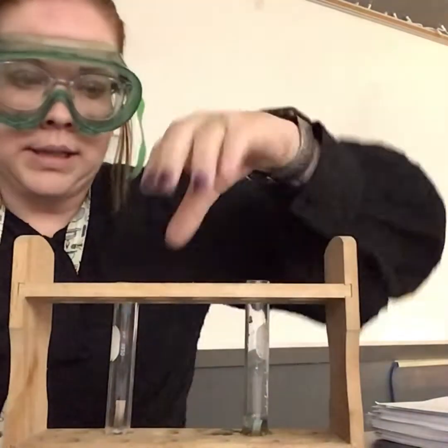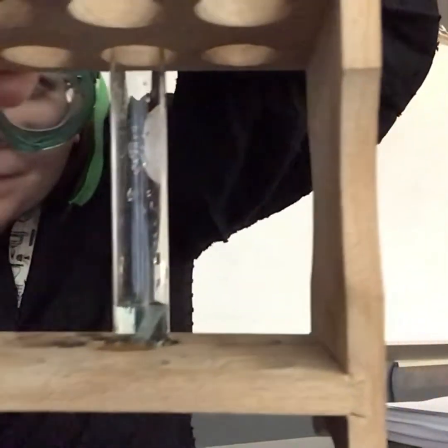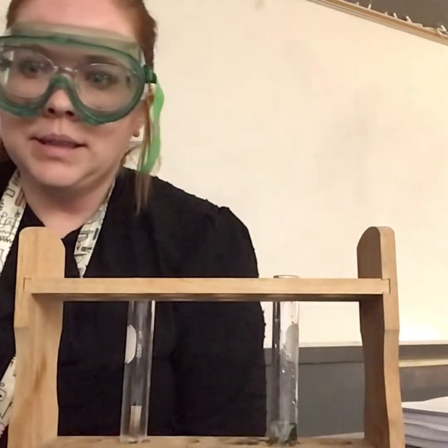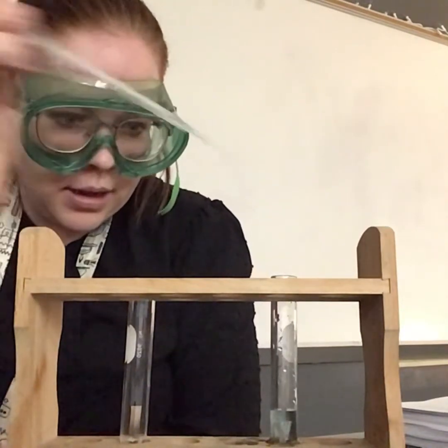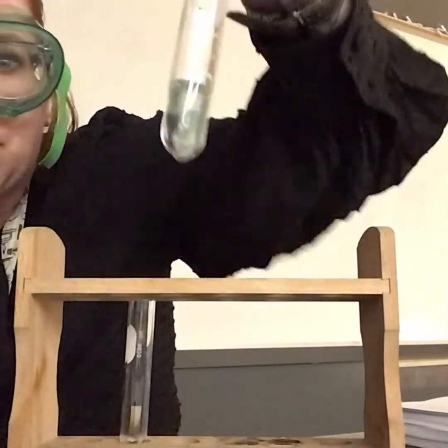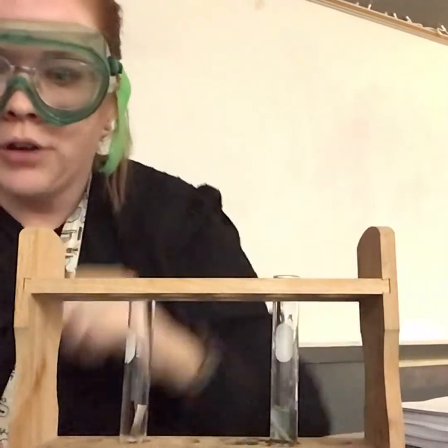Okay, so that's in there. I'm going to bring it a little closer so y'all can see. It's happening - I have some bubbles, it's kind of covering the magnesium metal right now, it's bubbling. I'm going to add a little more copper chloride. You can see bubbles all over the piece of magnesium.